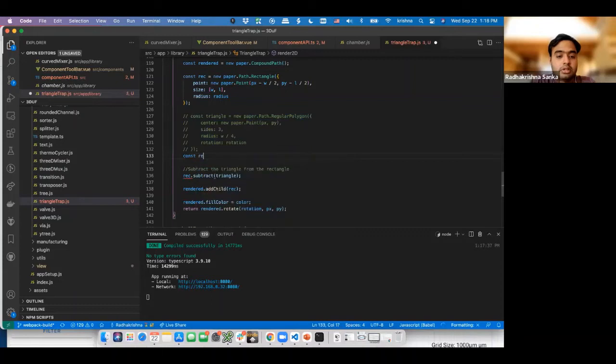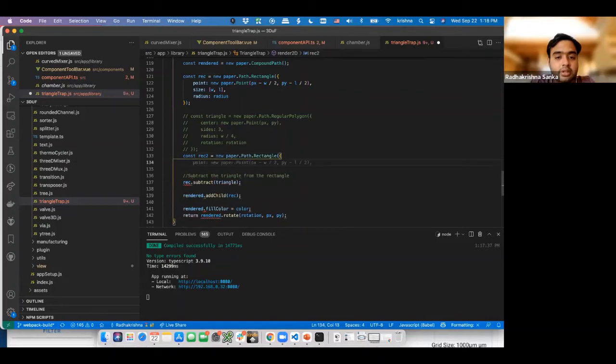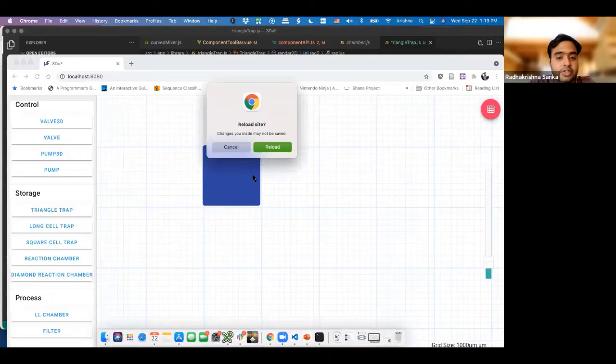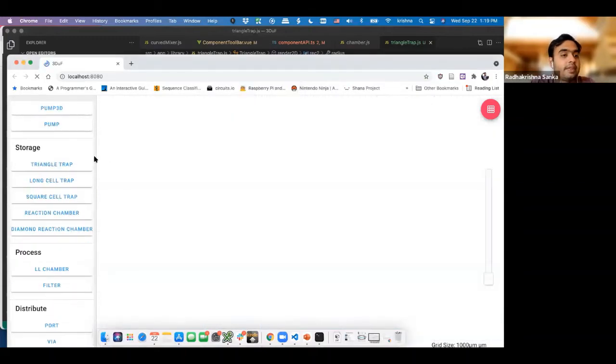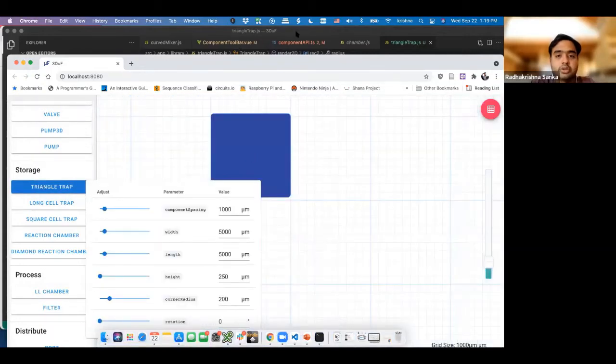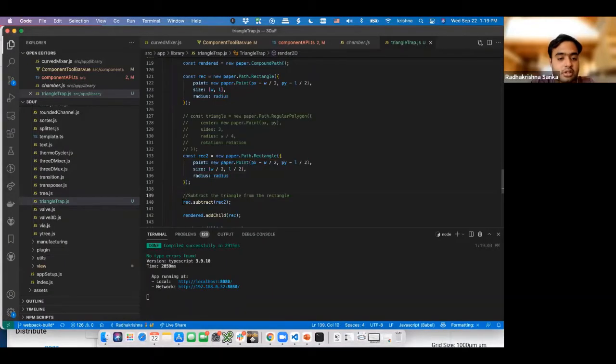const rect2 is equal to a rectangle, same point of origin, same size, radius is fine, and this one. And what I'm going to do is I'm going to say by 2 by 2. So this way, it's going to basically just cut a smaller rectangle out of the big one. I'm going to do that. If this doesn't work, I think I know why. Yeah. So the reason why this doesn't work is because I didn't realize this.